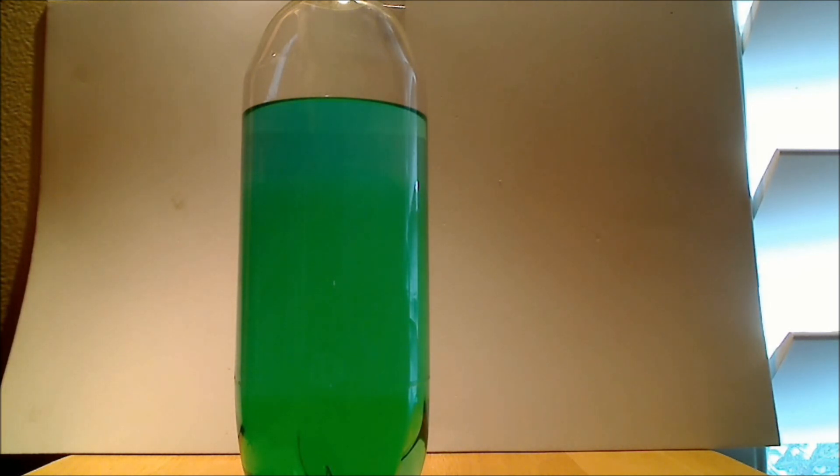I used salt for making ice cream, Morton salt. And then you get a nice clear solution. Otherwise you get a turbid solution.